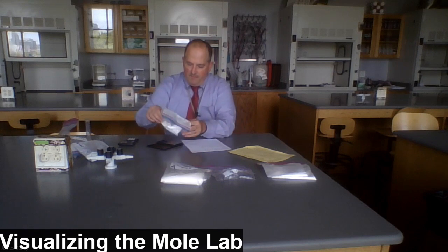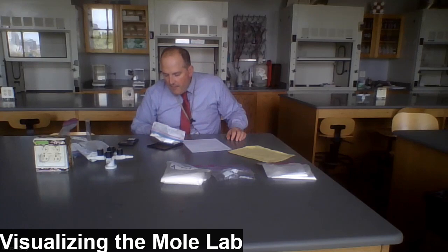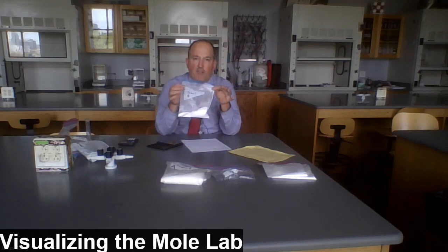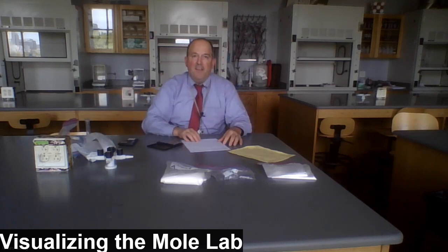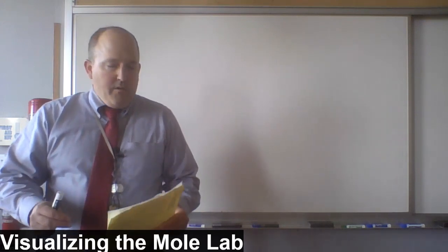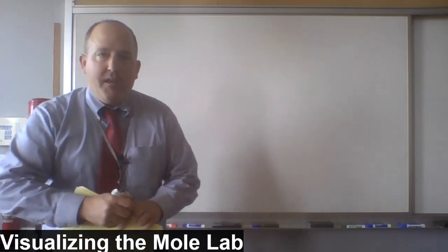Sample B, I get 80.5, 80.5. And again, let's subtract out the mass of the bag itself, which is 5 grams. And that would give us 75.5 grams. Okay, now let's do a little board work. Students, now we need to do a little bit of board work for station 3 in order to figure out which sample is calcium hydroxide and which one is calcium carbonate.